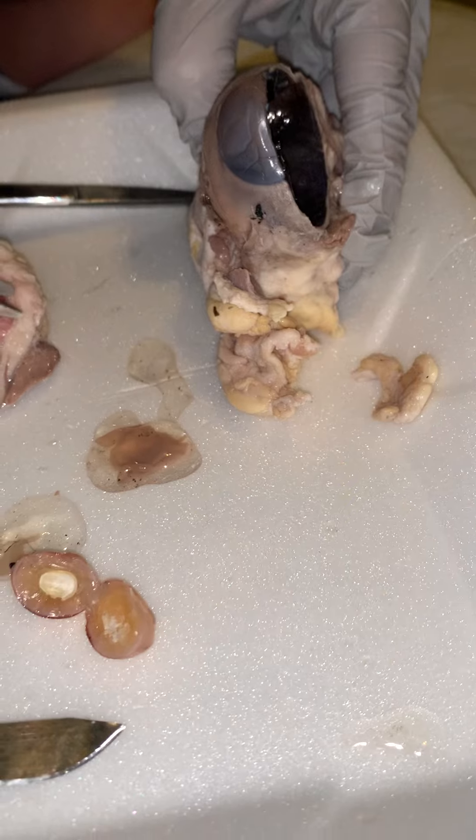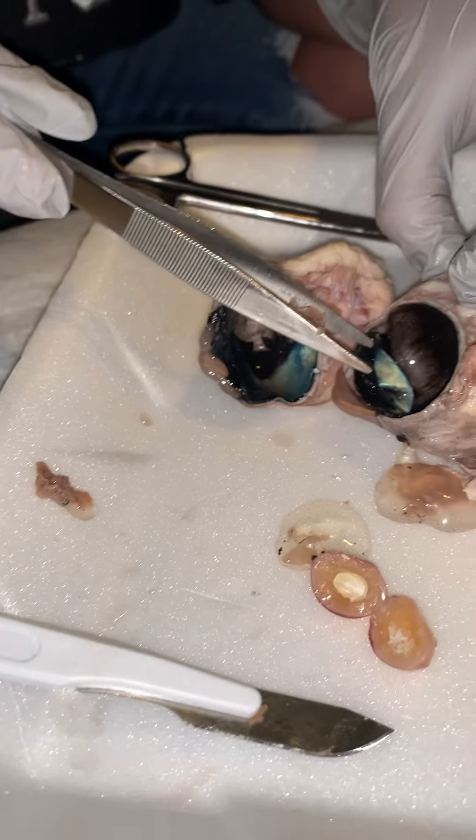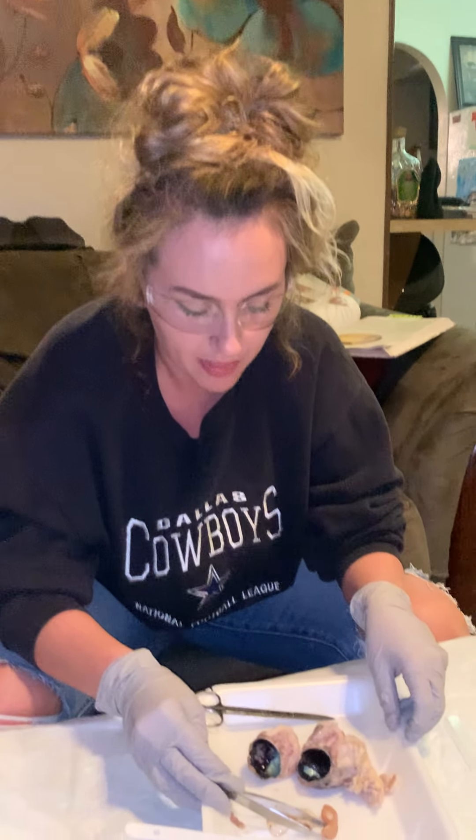But I think that's pretty much it. Very complex, lots and lots of tough tissue. That is for sure probably one of the toughest things I've ever dissected. And that concludes our dissection today of the sheep eye.